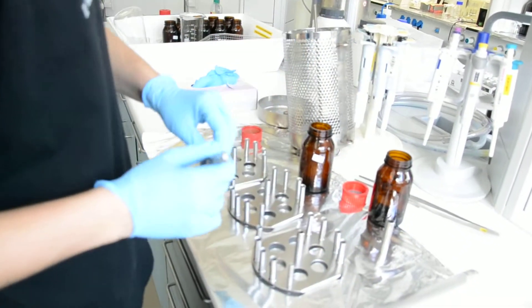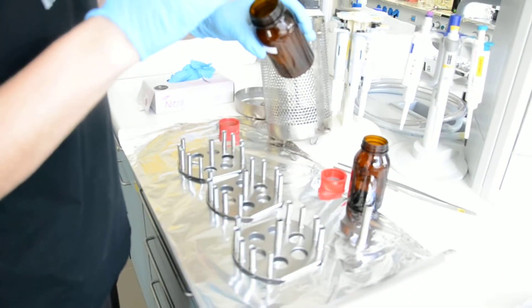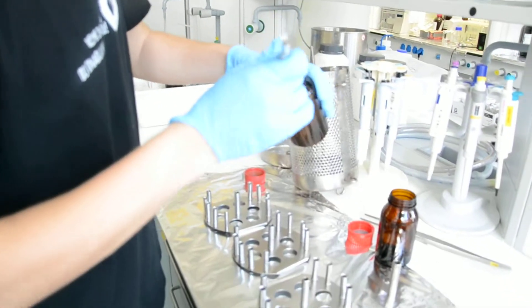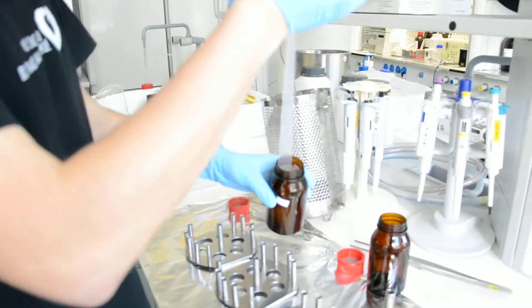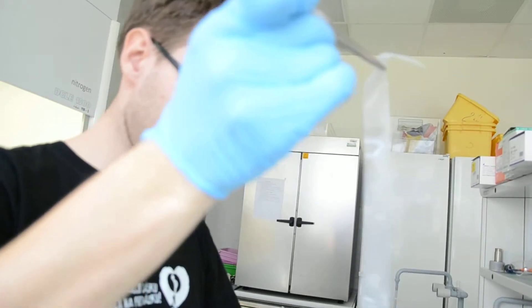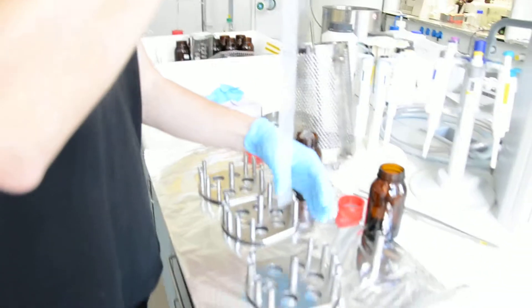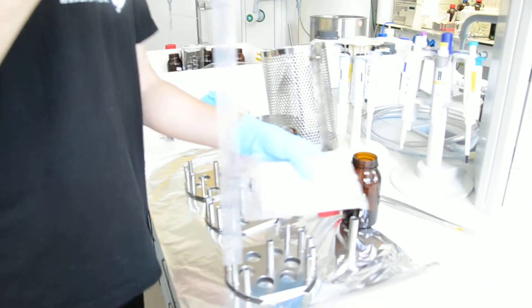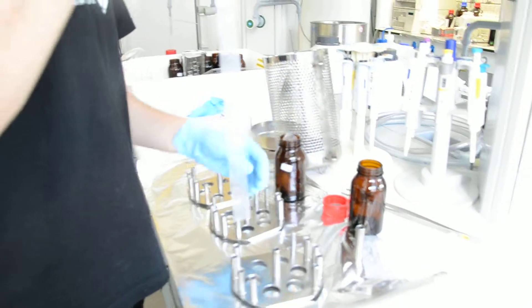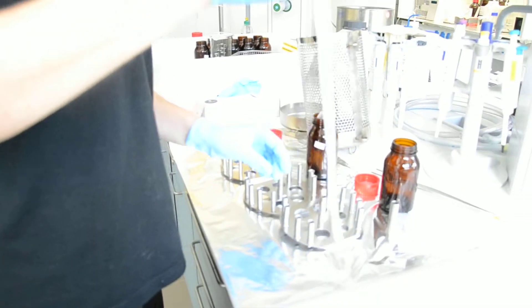Now we take the tweezers and put away one silicone sheet. The sheet will be attached to the spider with these plastic belts. We can leave it here for a moment. Prepare two belts for each silicone sheet.